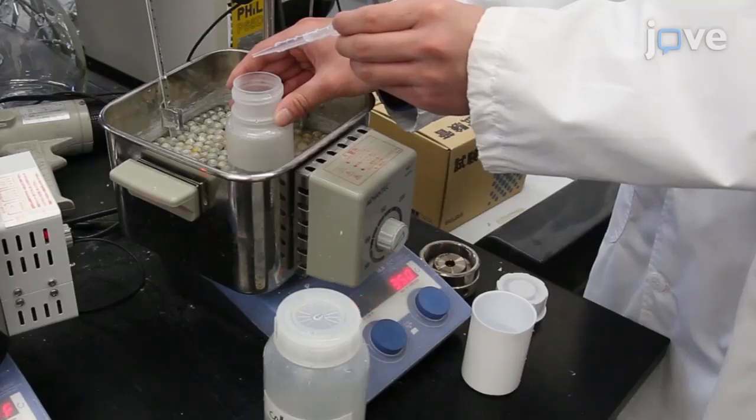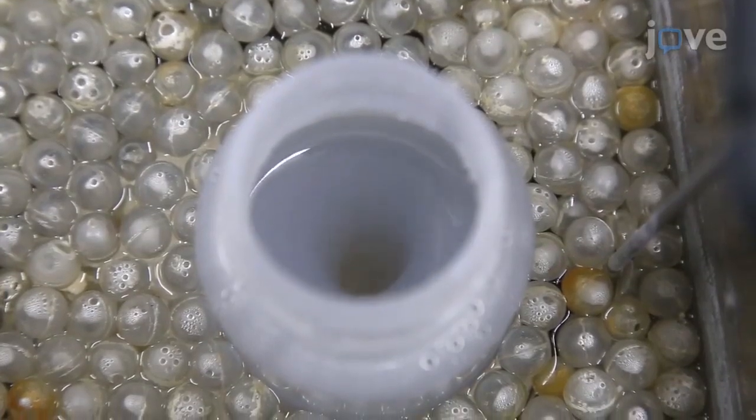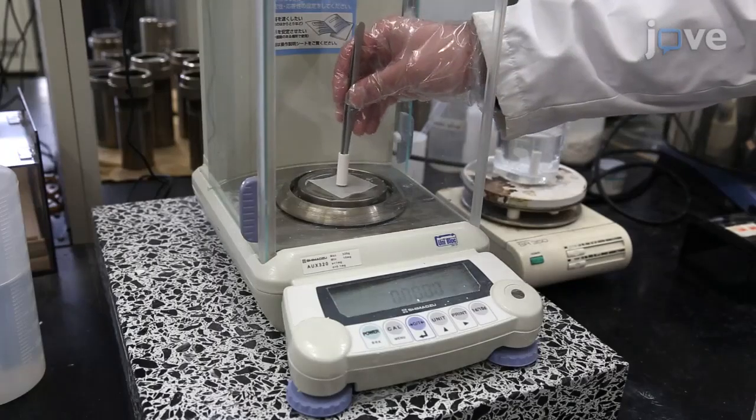Operation and equipment for zeolite membrane preparation are quite unique. This video can help you learn how to prepare zeolite membranes.